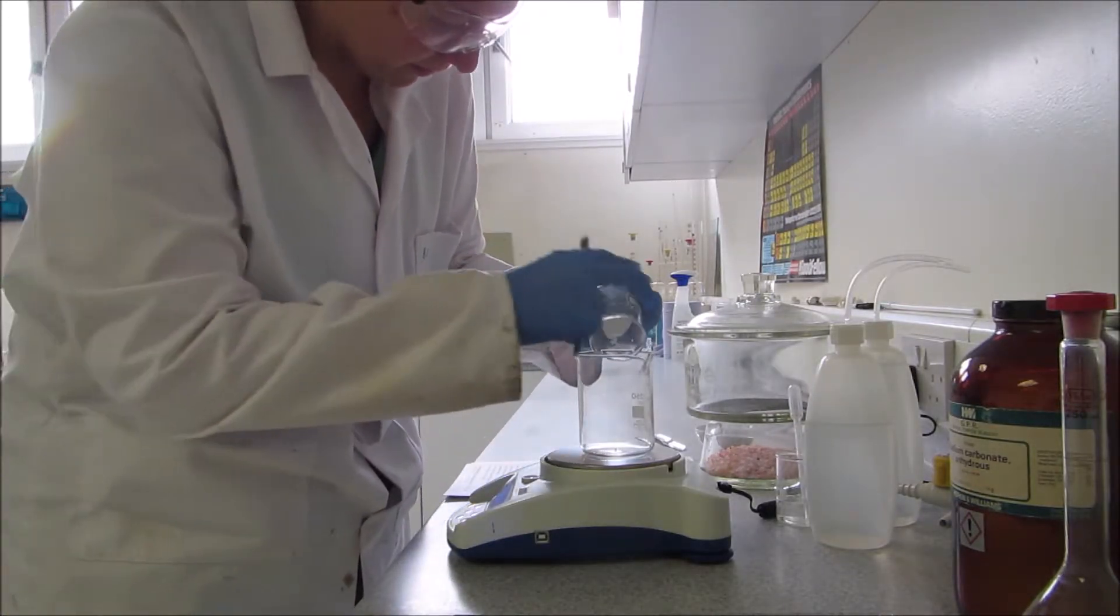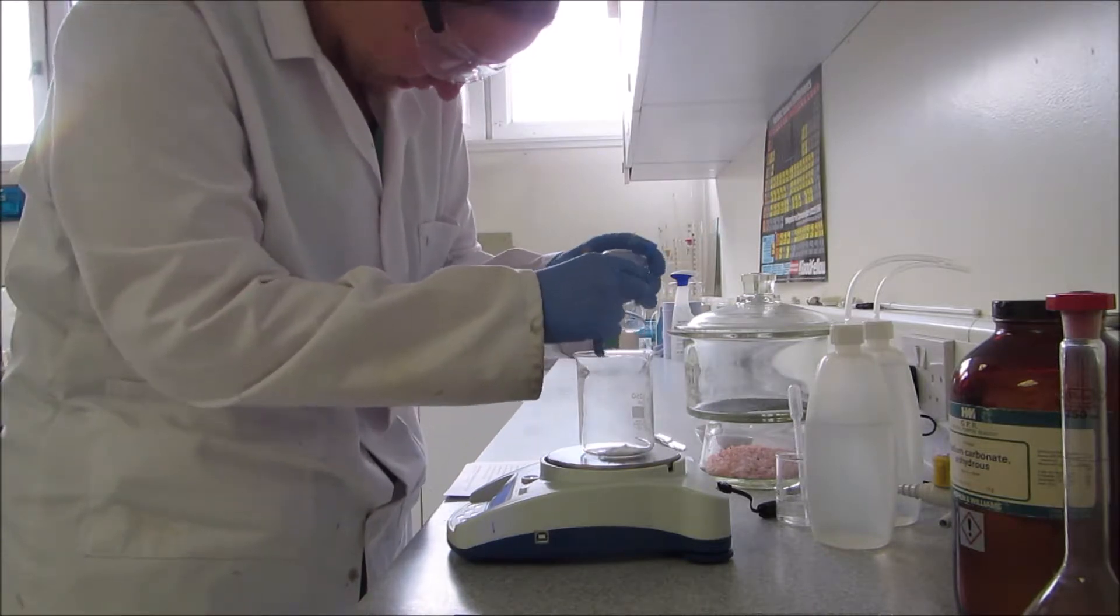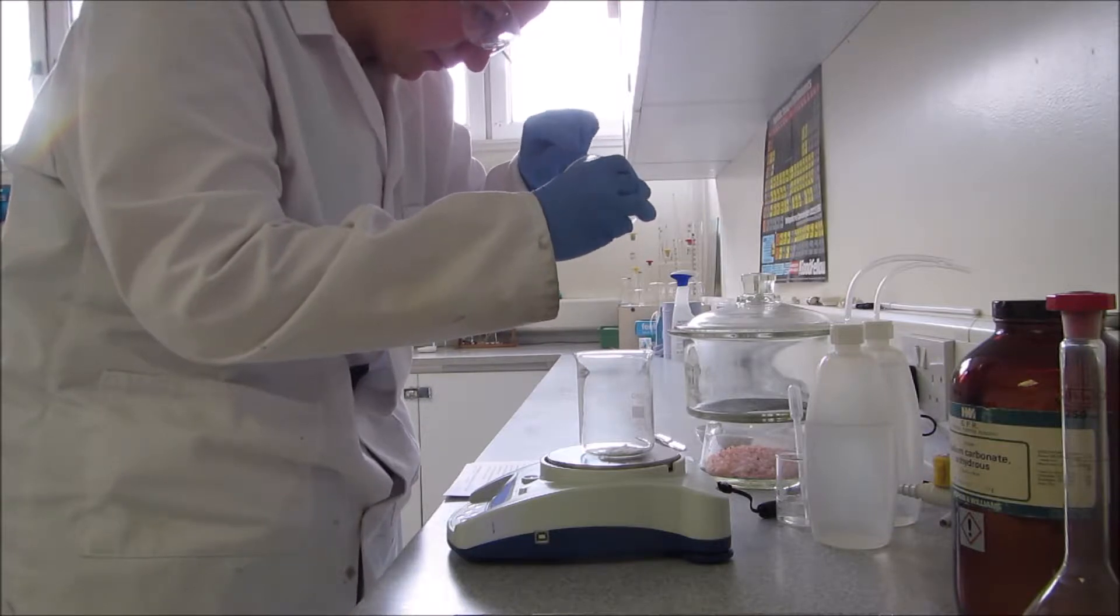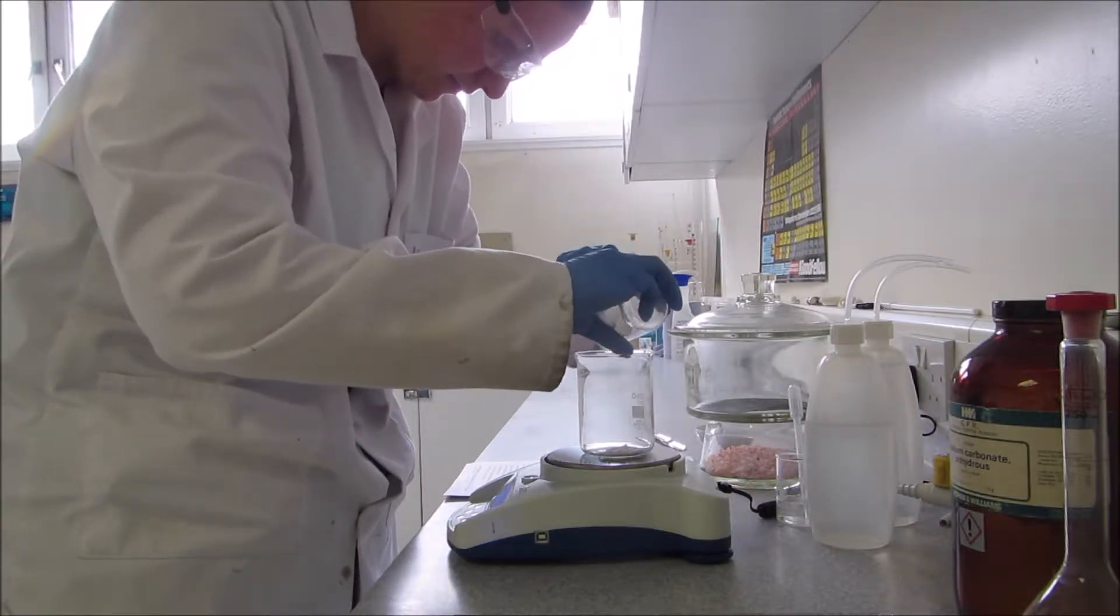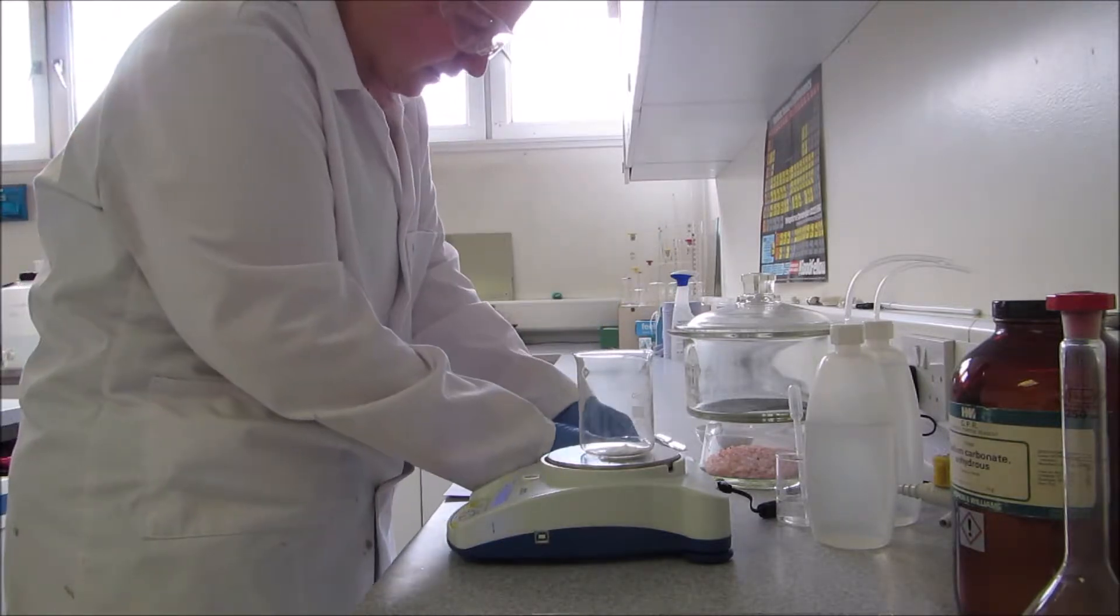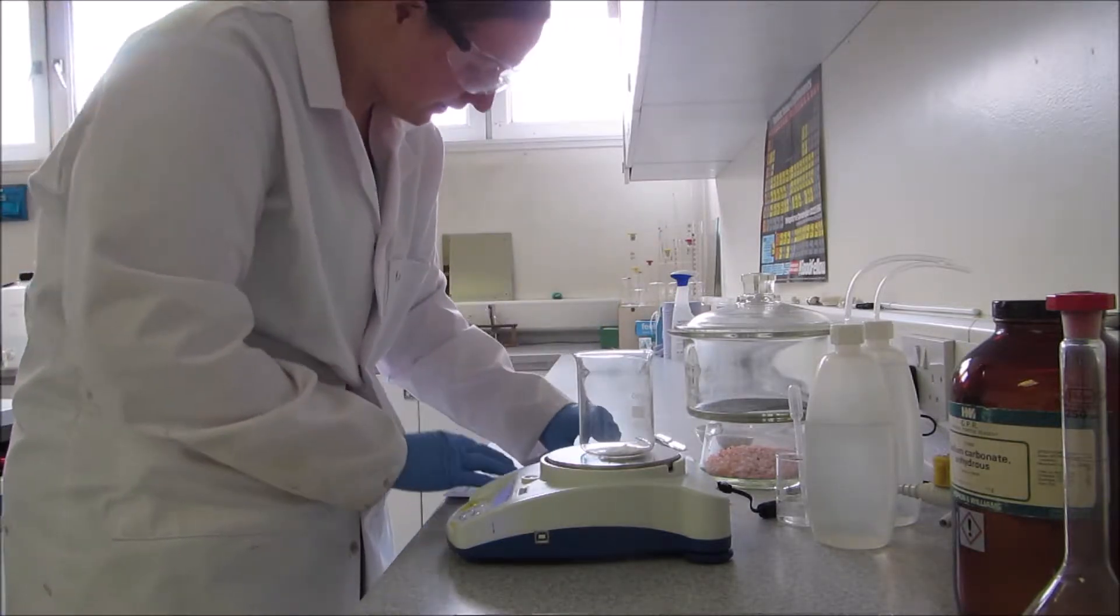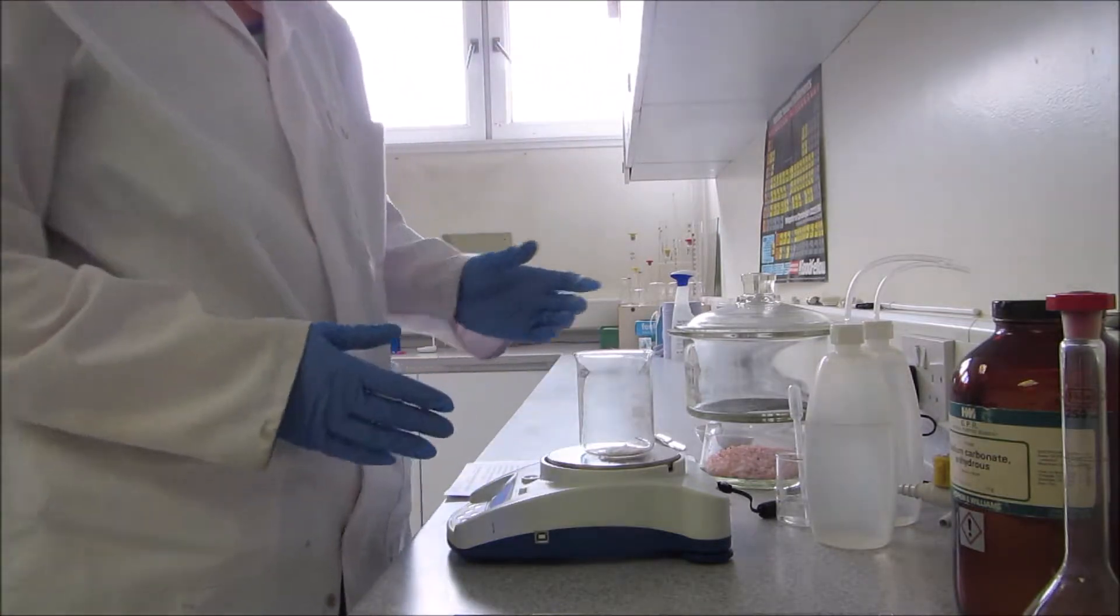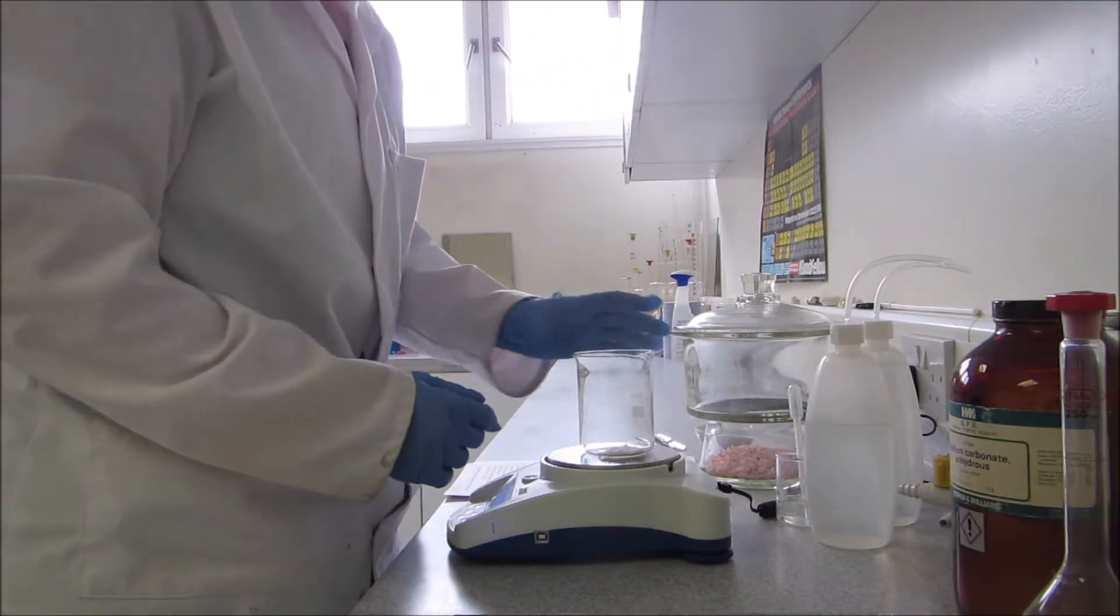I'll scrape all of my sodium carbonate solution in and put my sodium carbonate powder into the beaker. And again it's coming up at 1.20 grams. If there is a discrepancy in this, just take the average between the two.